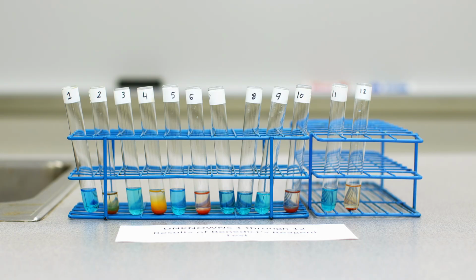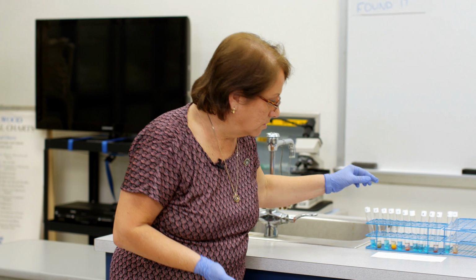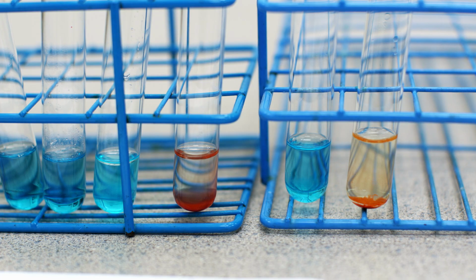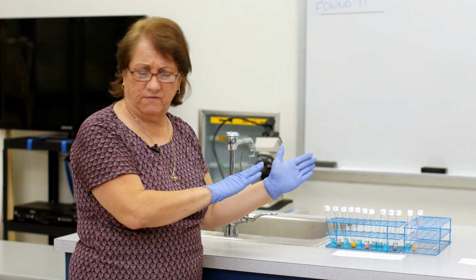So if you know what the Benedict's reagent positive result looks like and the negative result, you can tell if your unknown has it or doesn't have it. For example, here, not knowing what's in there, I can tell you that's a negative result because it's blue. Looking at this one here, this is a positive result because it's got a color and it's precipitated. It's an orange color and it's precipitated. Okay, so you can look at your unknowns and figure out, I must have some reducing sugar if it comes out positive. You'll do the same thing for the Lugol's test.